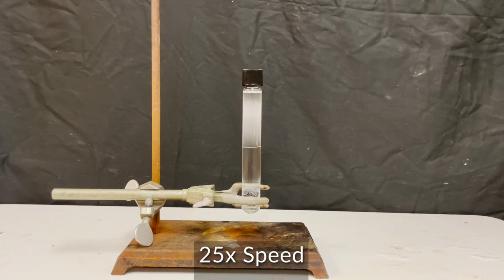Letting it sit for about 10 minutes, we only see 3 layers form this time. The glycerol and ethylene glycol layers have mixed, forming a new layer with a density somewhere in between their 2 original densities.